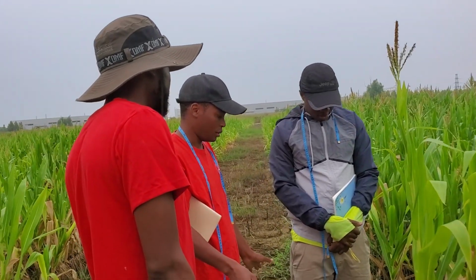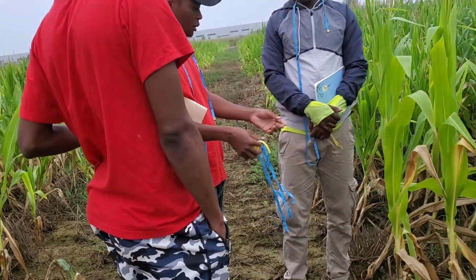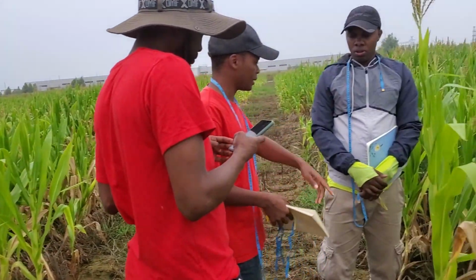There we finished. Span is something that can be measured, because measuring this needs two people, one to hold and one to measure. But span, I think you can start measuring this.